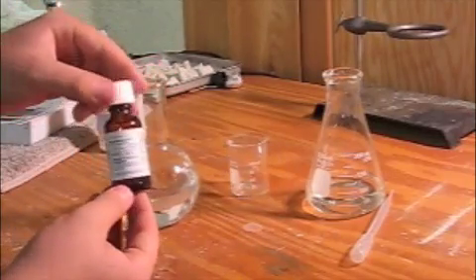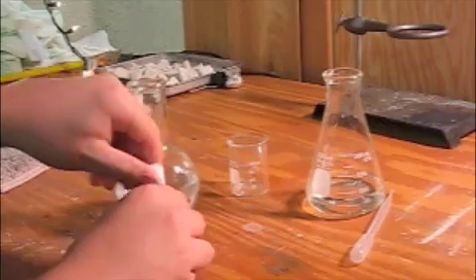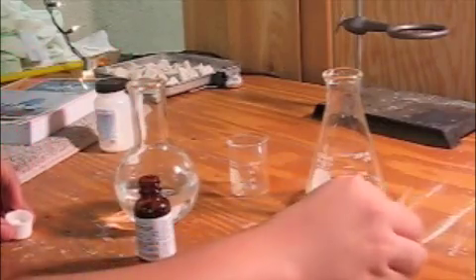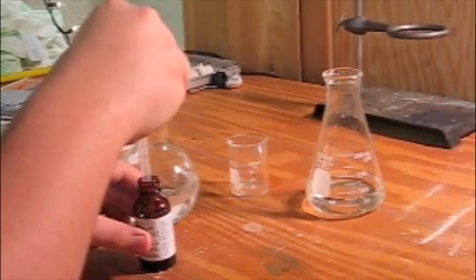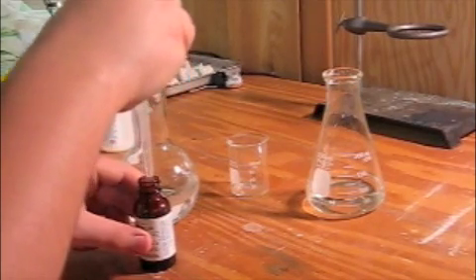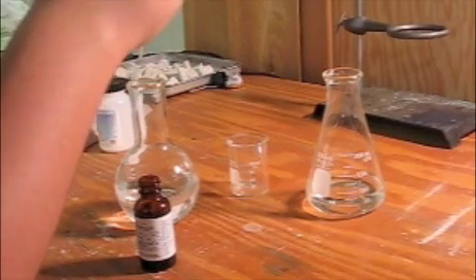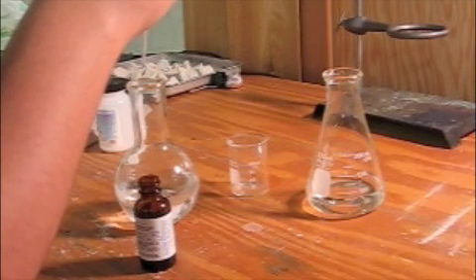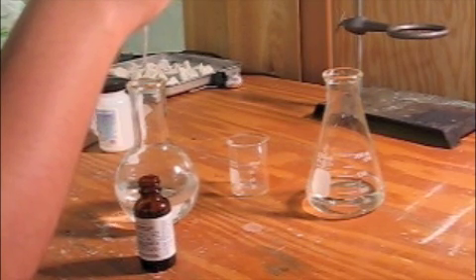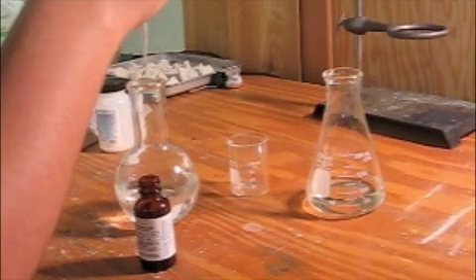The next step is to add hydrochloric acid. We put this in drop-by-drop because we don't want to overfill the solution with hydrochloric acid.